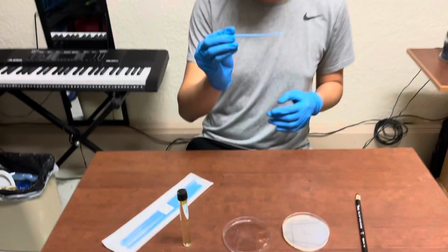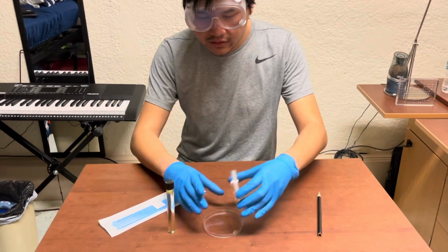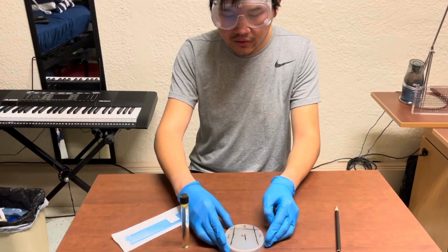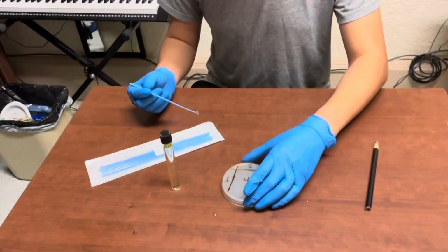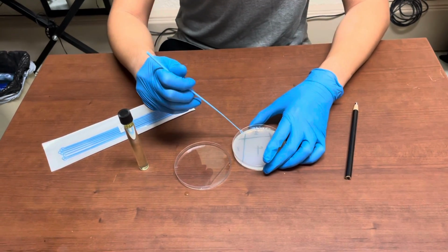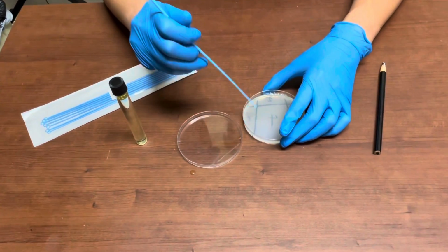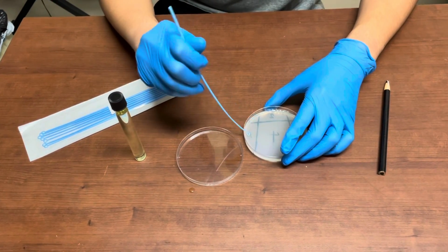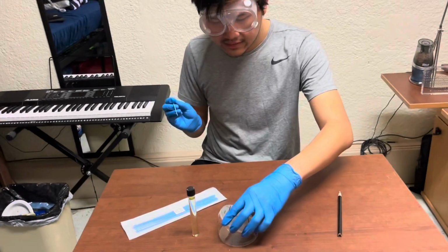Now, I'm going to take this plastic inoculation loop, I'm going to dispose of it. Now that I'm done streaking quadrant 2, I'm going to quickly close the agar plate to avoid contamination. I'm going to rotate the plate counterclockwise 90 degrees. So I'm going to take another plastic inoculation loop, and now I'm going to open the agar plate, and furthermore, from the corner of quadrant 2 and quadrant 3, I'm going to directionally streak like so. Being careful not to tear the agar. So I'm going to cap this.